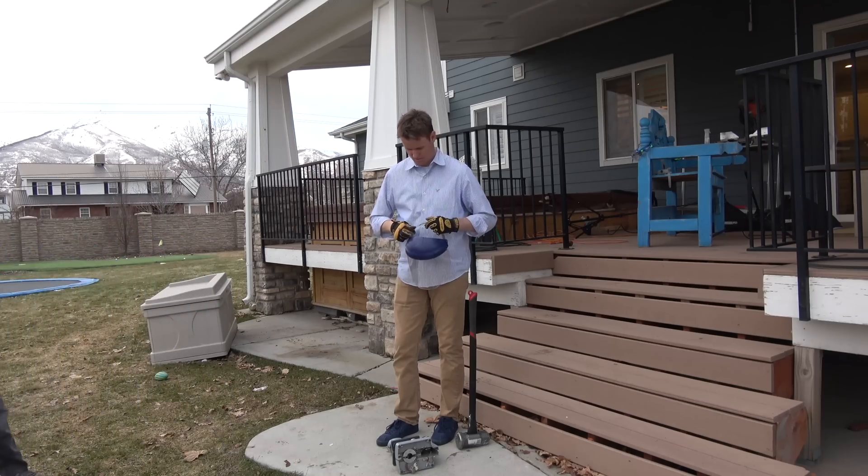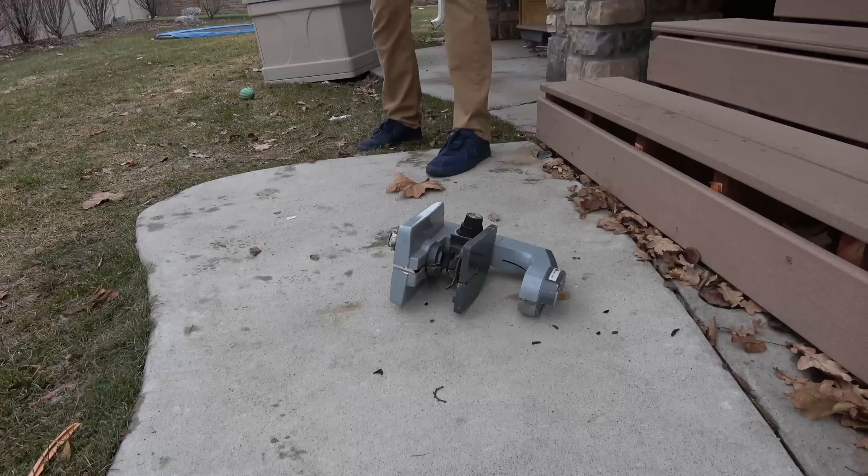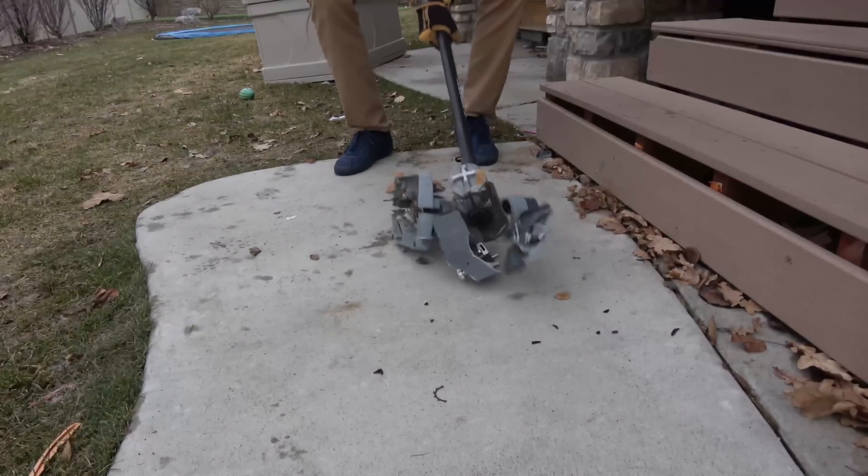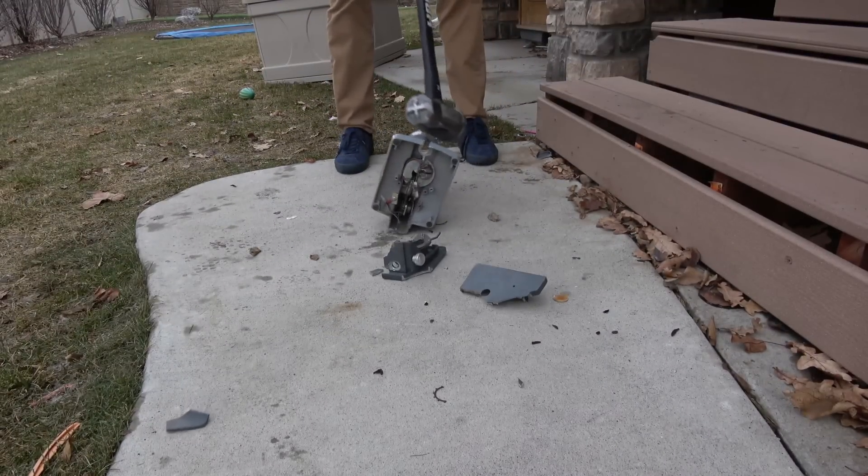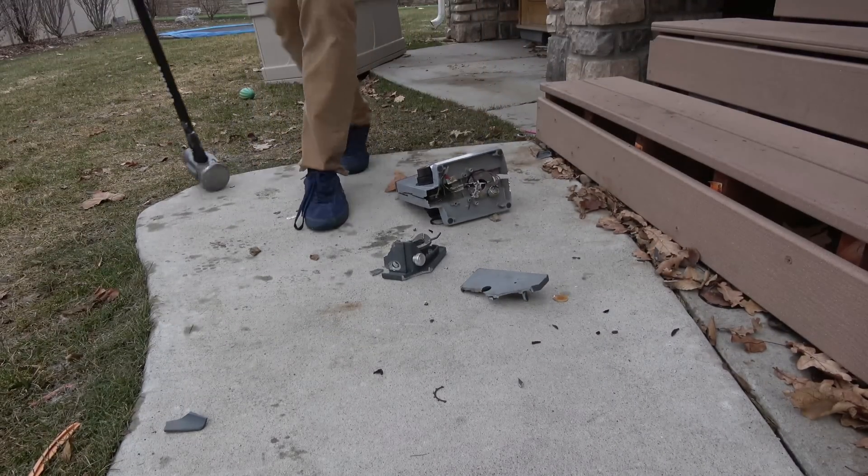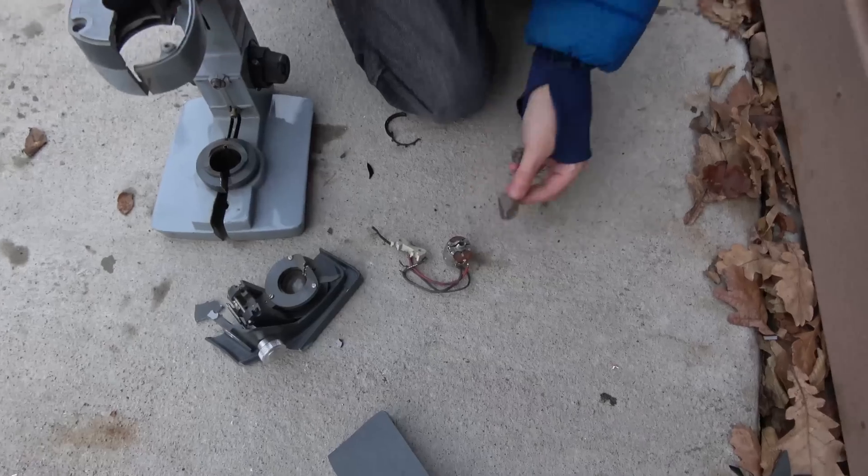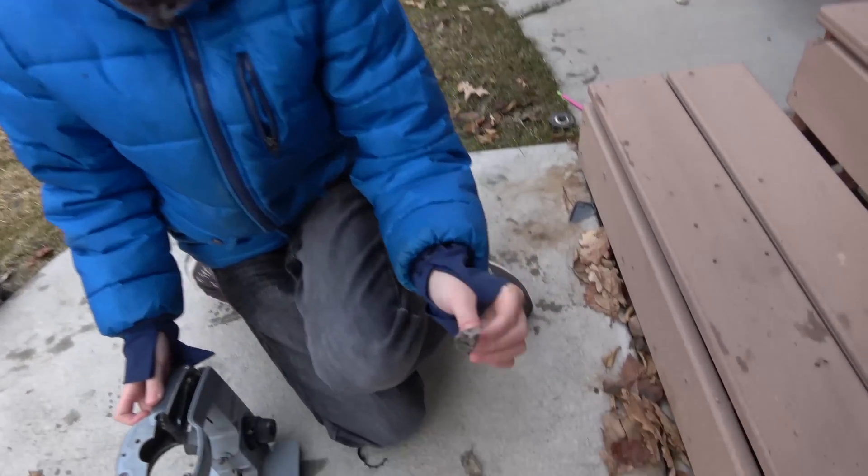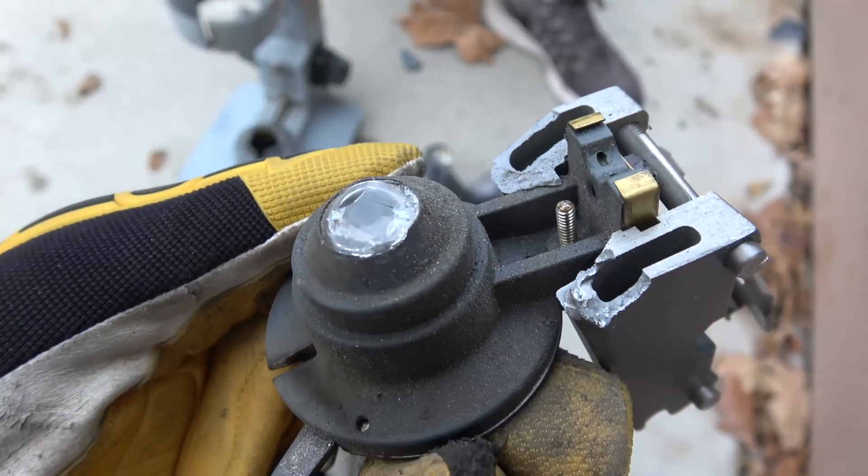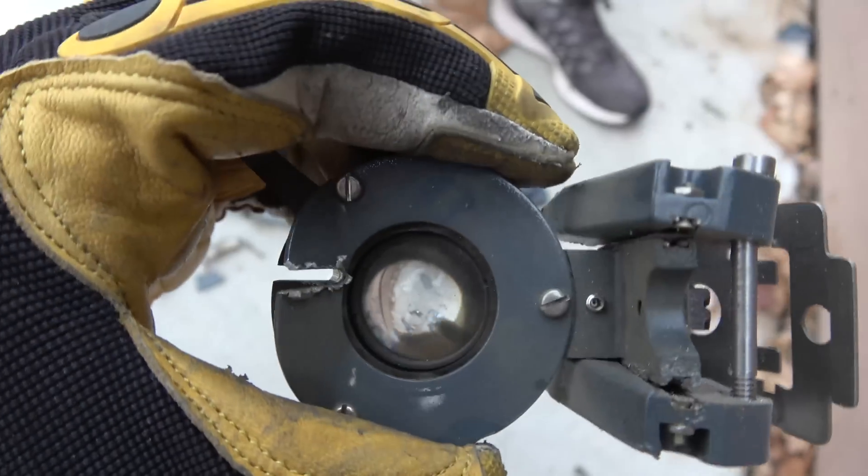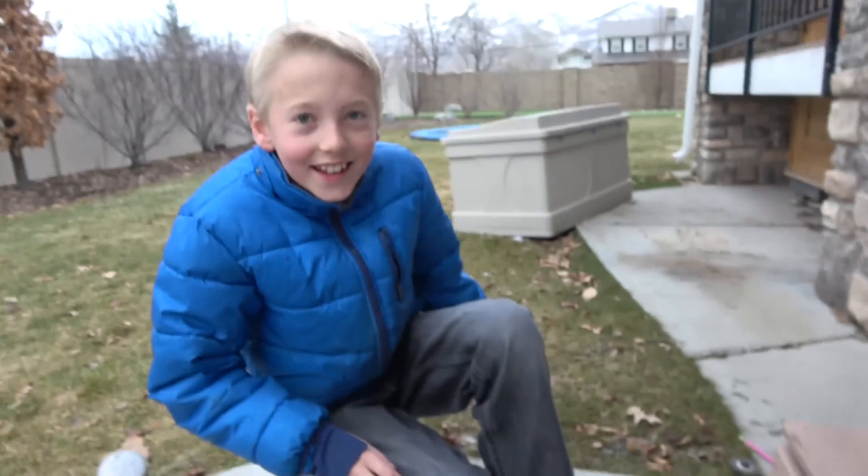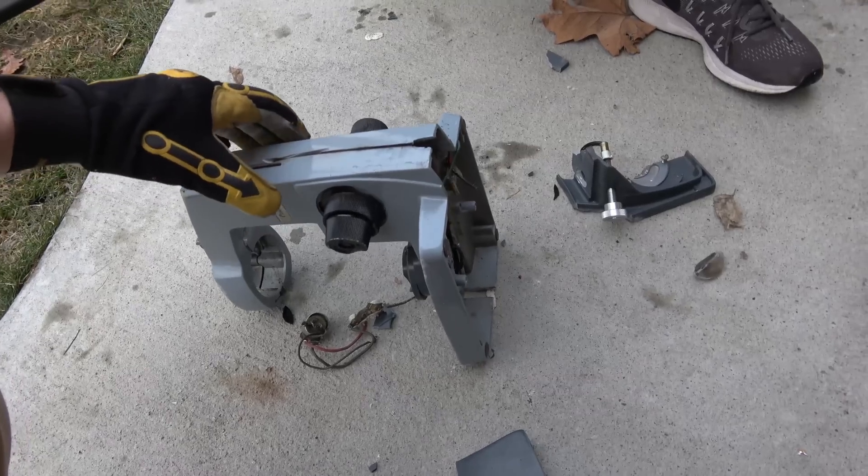Okay, smash it and I'll just back away. Okay, yeah, you succeeded on that one. Whoa, that is one thick lens. Isn't it crazy thick? Look at that. See how thick that glass is? We even broke it and it just chipped off part of it. You demolished it with that one. That was a good hit. Let's give it another hit like that.